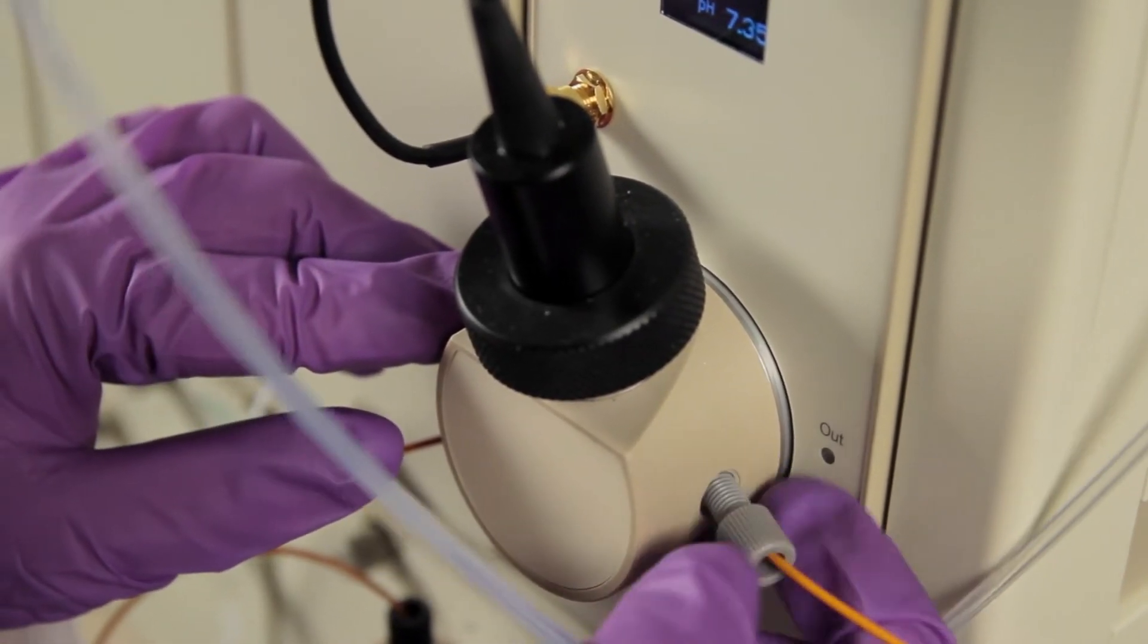Such as in antibody purification. The NGC-PH valve has been designed with easily accessible calibration ports, allowing for convenient calibration without removing the probe. The probe can also be bypassed when the NGC system is being cleaned.